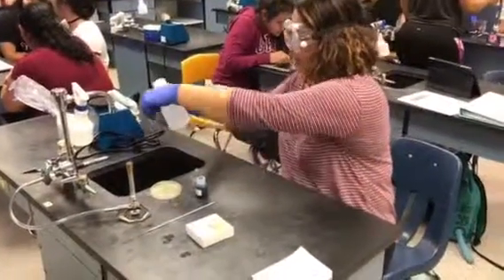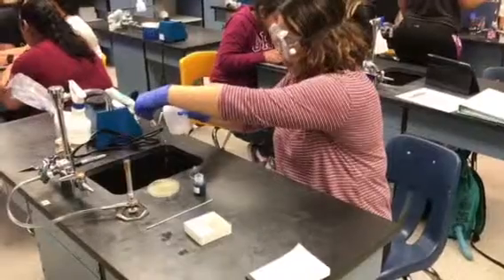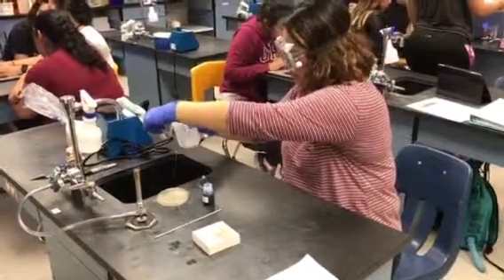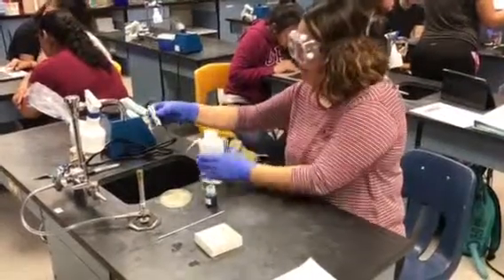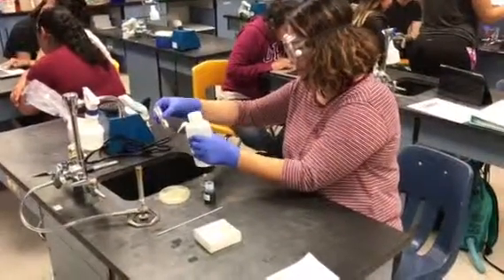Next, you're gonna be using DI water to rinse your slide. Make sure you rinse it thoroughly, making sure that there's no more stain left behind. Also be a hundred percent sure that you are using DI water — you do not want to use sink water.